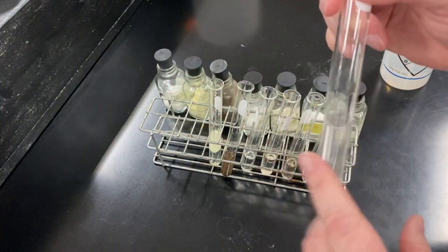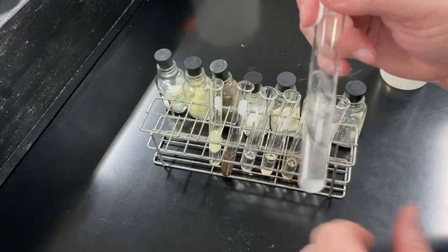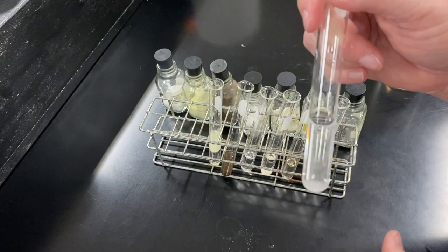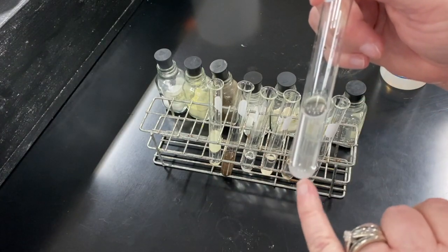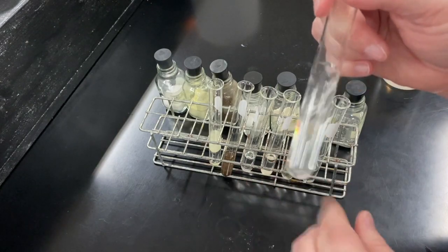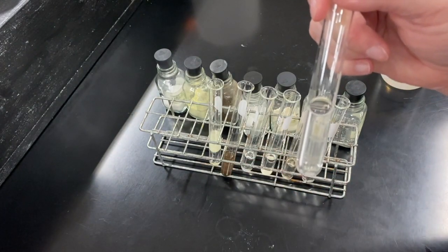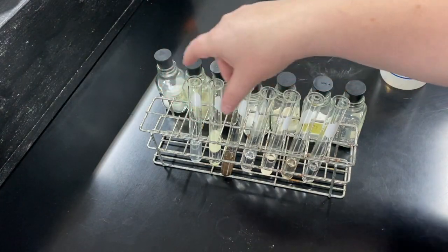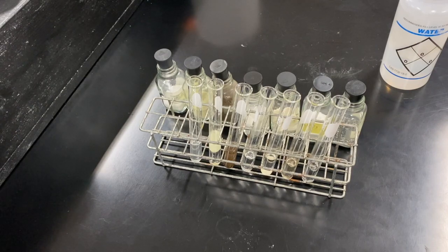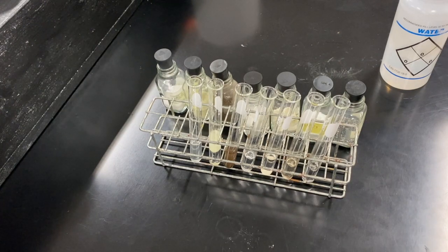Then we have salt — sodium chloride, NaCl, table salt. You can see these lines as it mixes — that is the solid dissolving, like little threads in the water. The amount of solid sitting at the bottom is decreasing and it's almost completely dissolved. Salt does dissolve in water, which makes sense because there's salt in the ocean. That is your answer to your odor and solubility, and that is the end of Part A — your data table for Part A should be completely done.